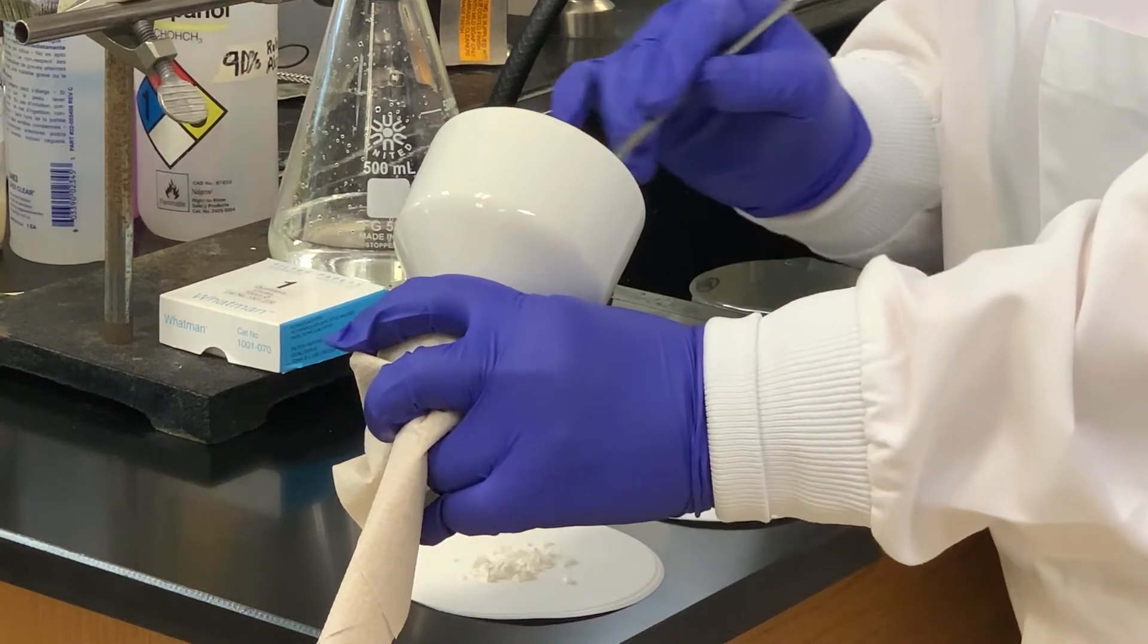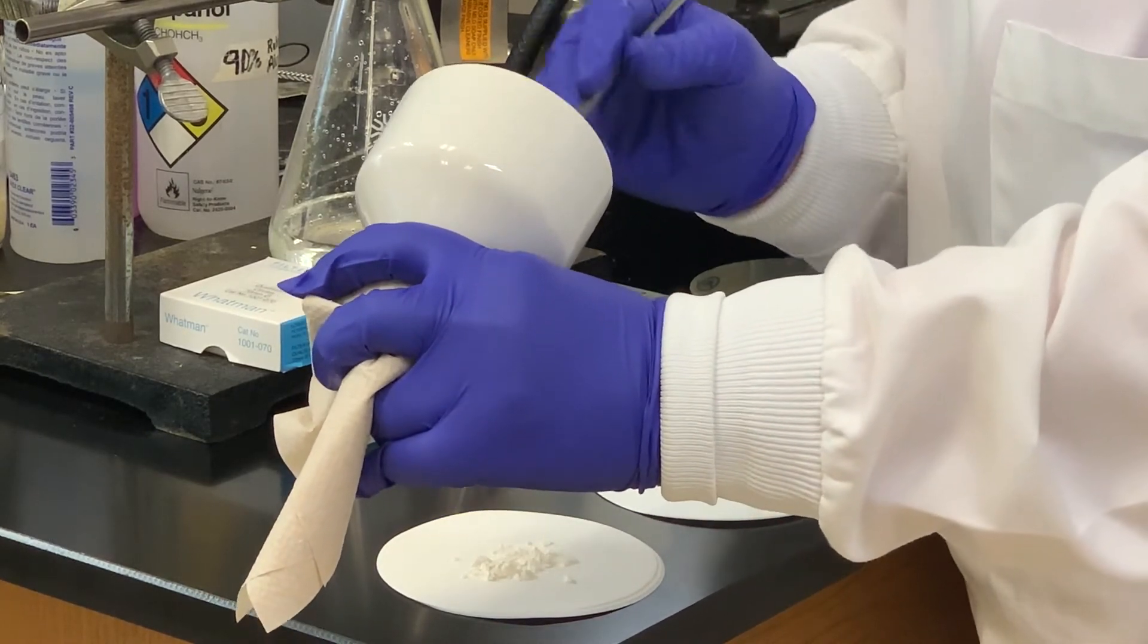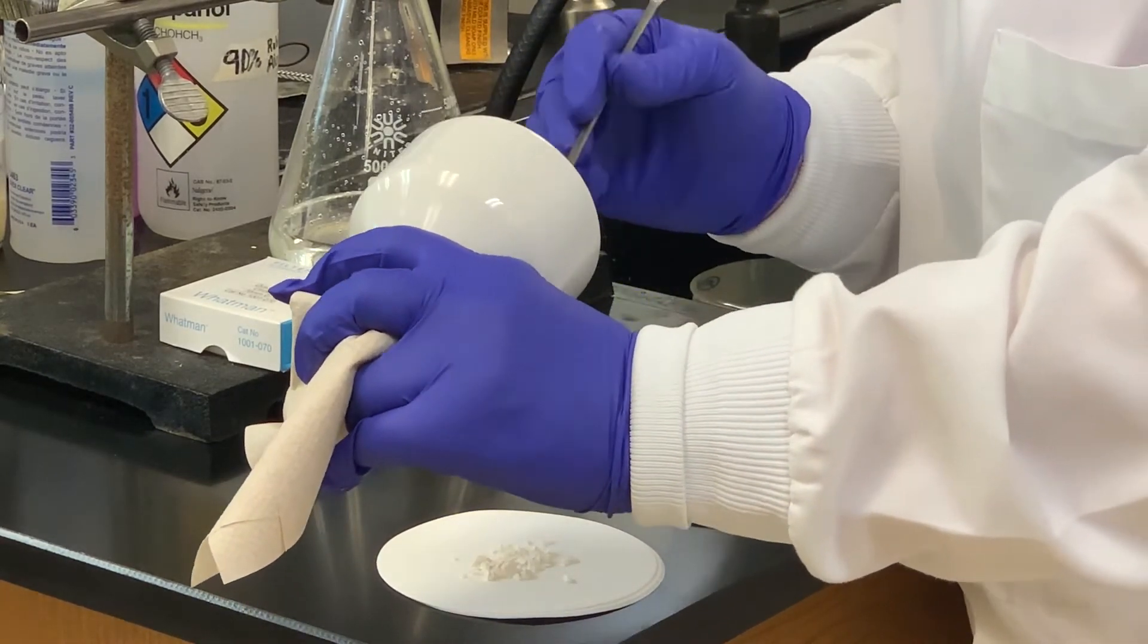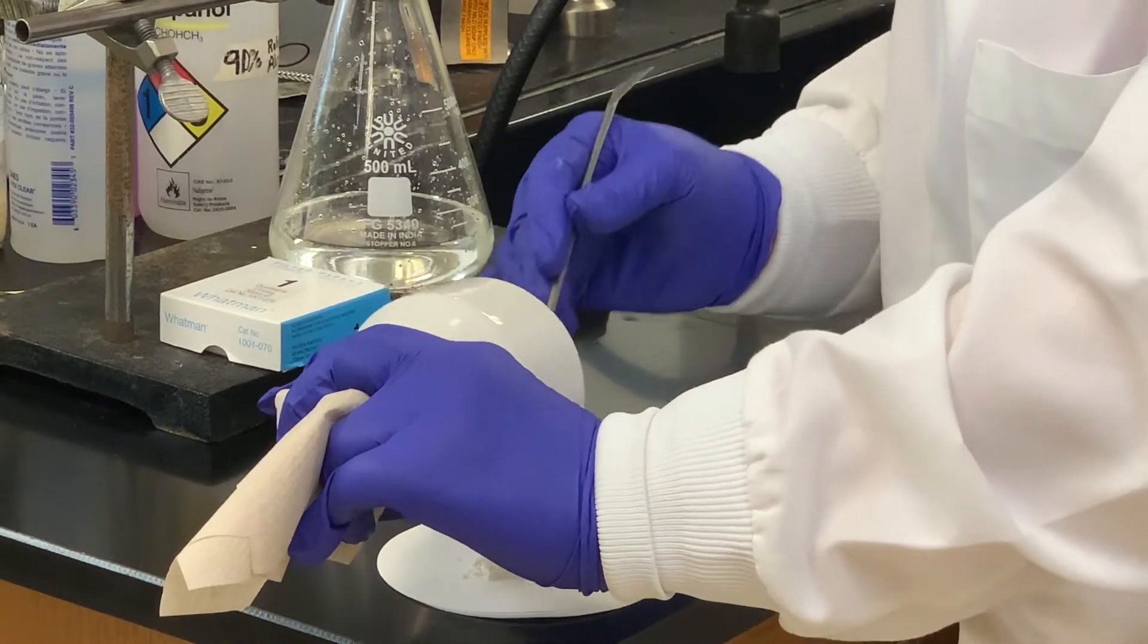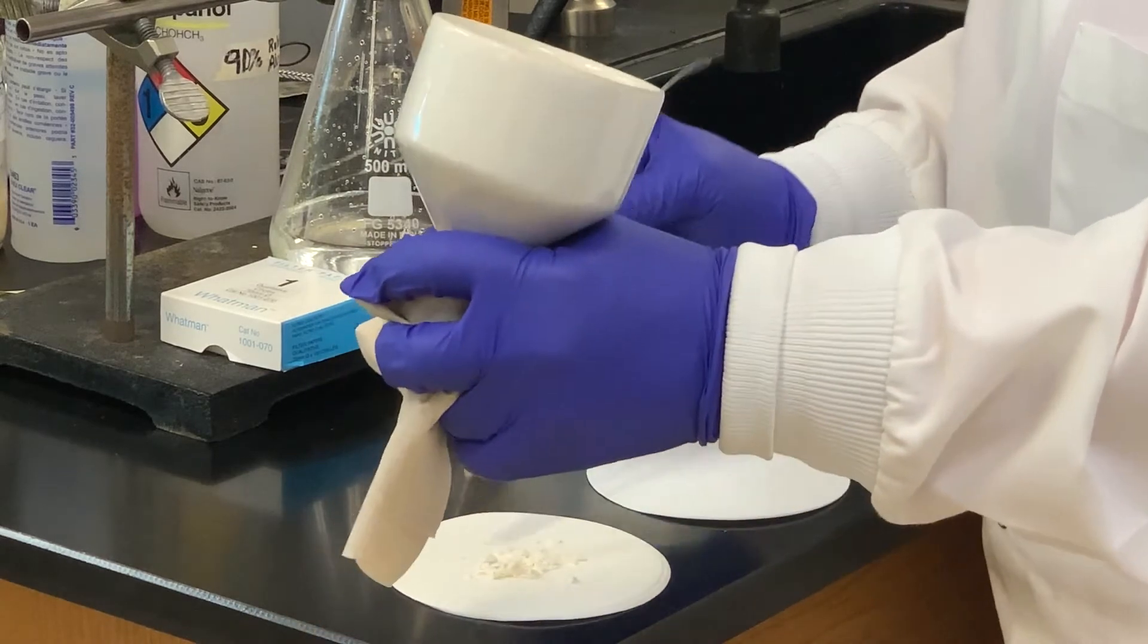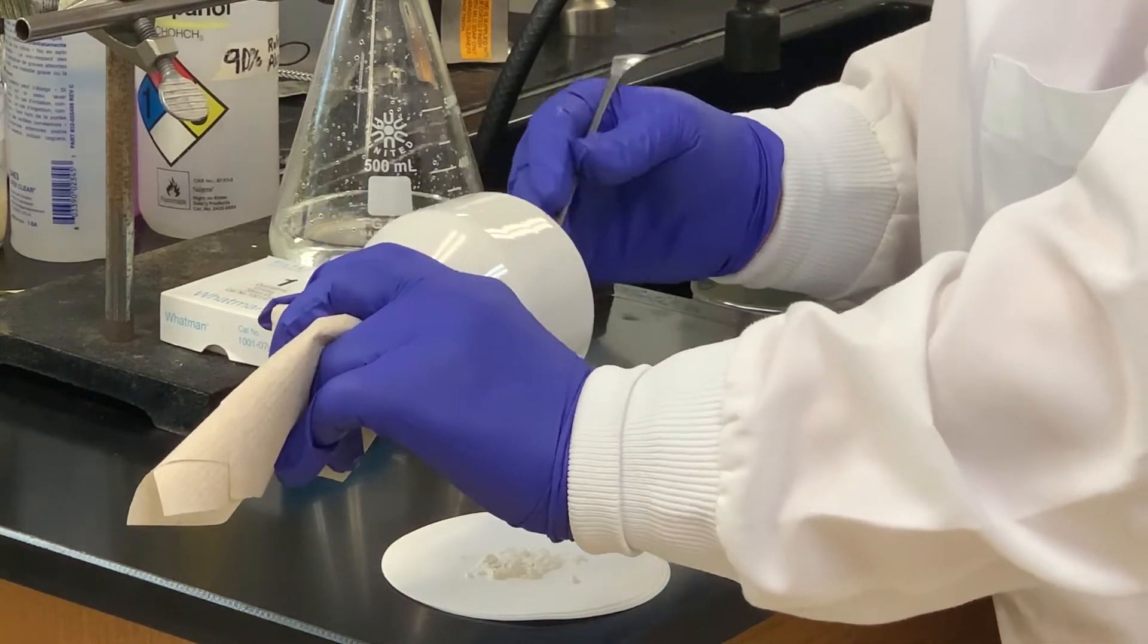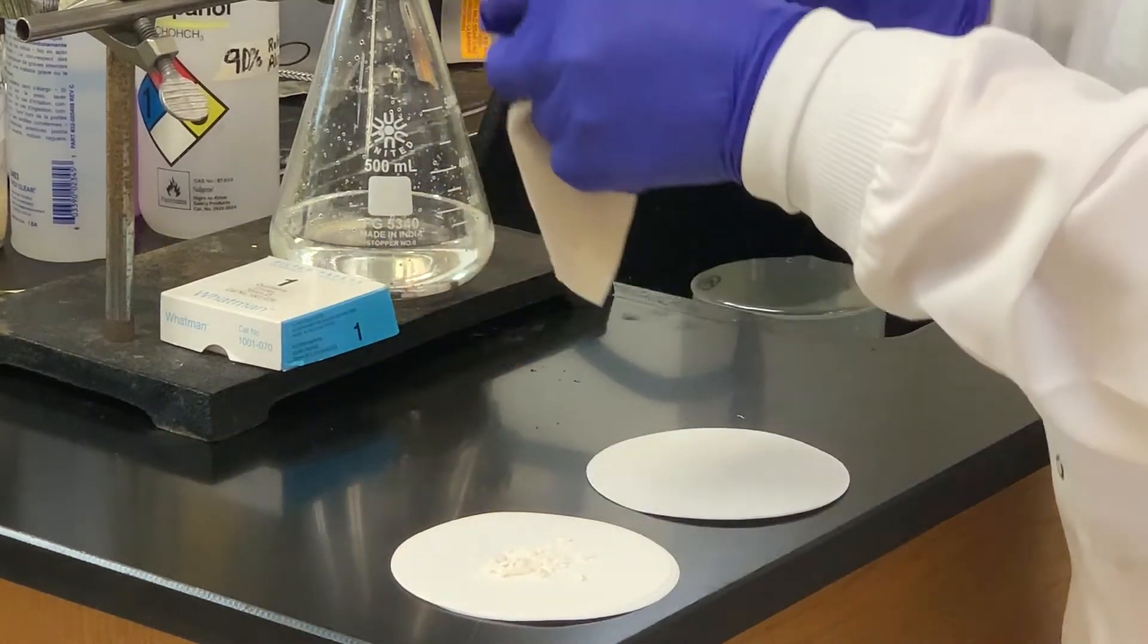Sometimes you have to be careful too, especially when the filter paper is fairly wet, because when you're scratching off the solid, sometimes it's easy to get a little bit of paper with it. That's pretty good.